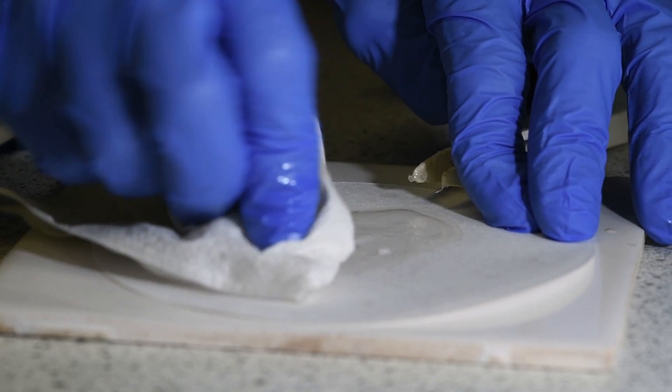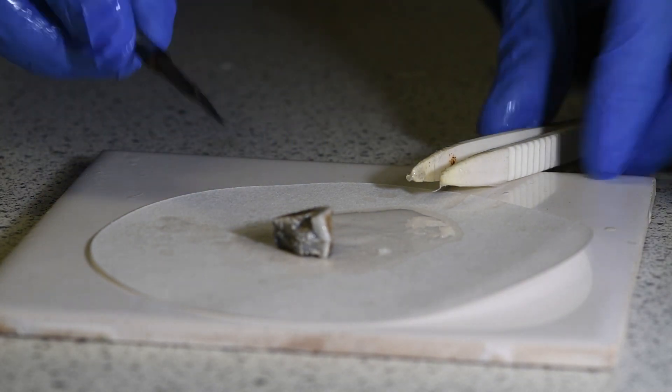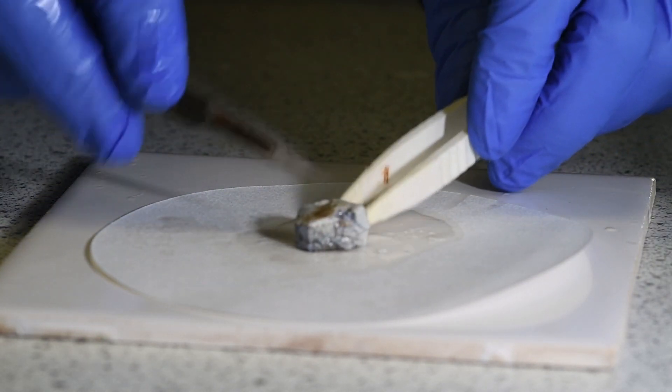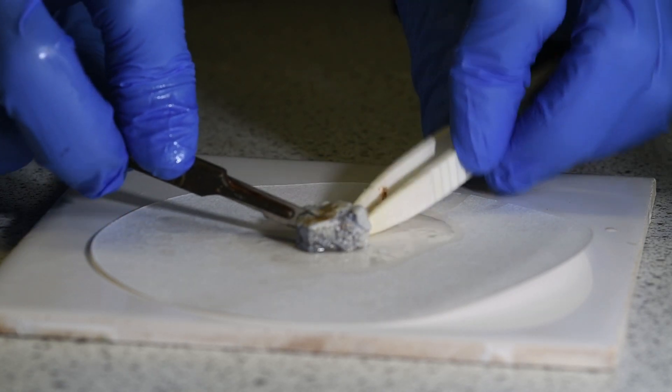And you'll notice that it looks quite dull. It doesn't really look much like a metal at all at the moment. Very, very soft, so I can cut through it very easily.